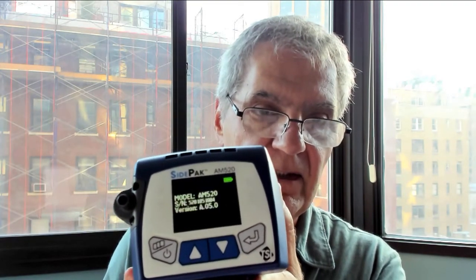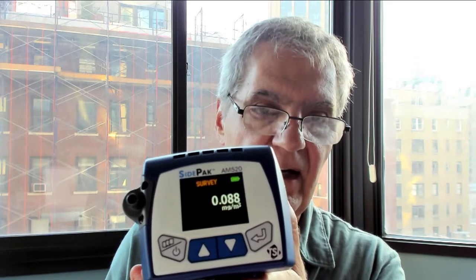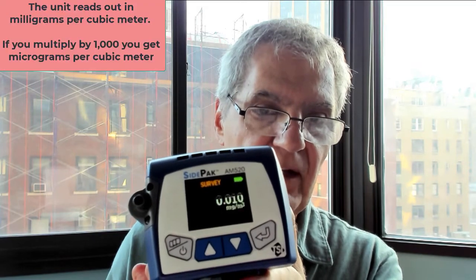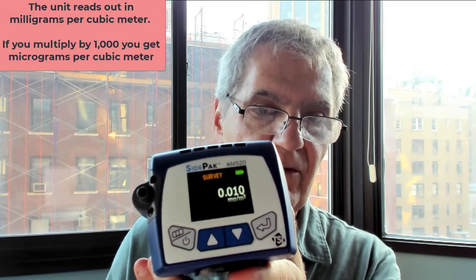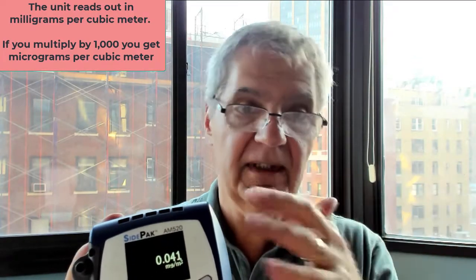Here's the on/off button. The minute you start it, it makes a hum and right away it starts taking readings: 12 micrograms, 10 micrograms, 9 micrograms, 10, 7 — it seems all over the place, but that's how dust is.